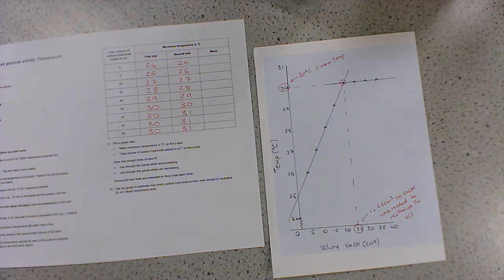And finally, I suppose we can see very clearly that the temperature has increased. And therefore, it must be an exothermic reaction.